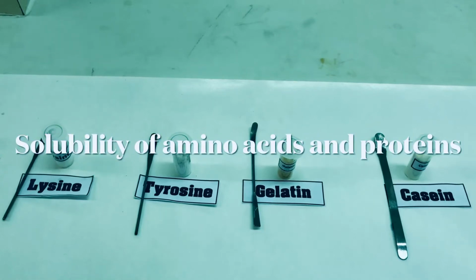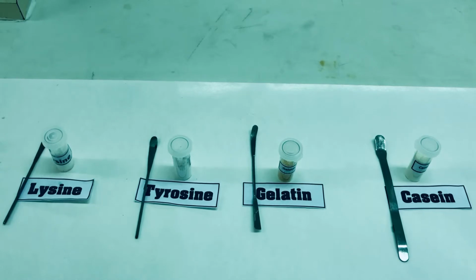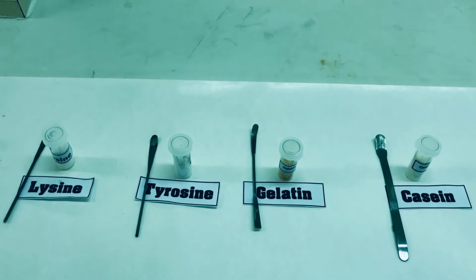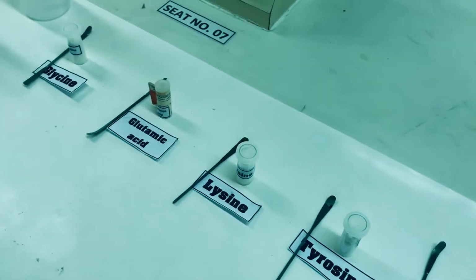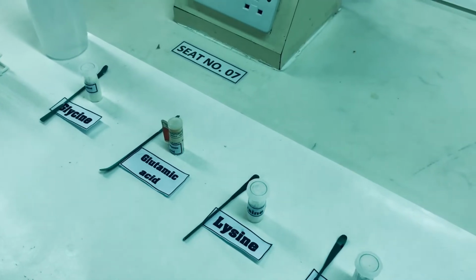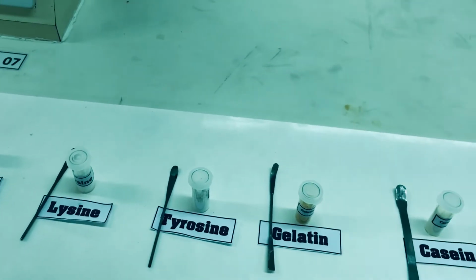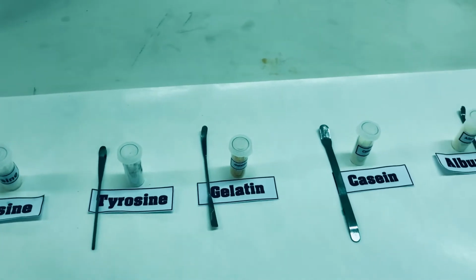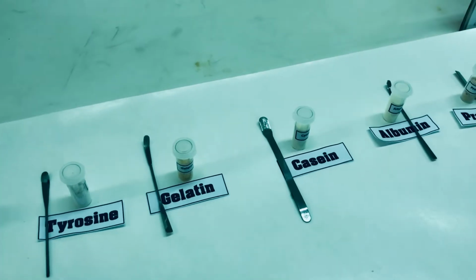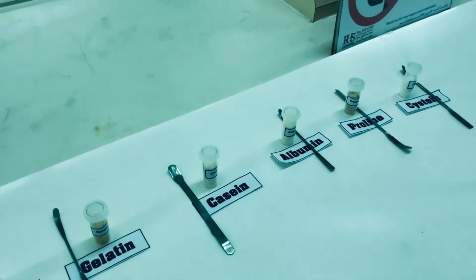The objective for today's experiment is to qualitatively test amino acids and proteins in order to describe their structure and properties. For the purpose, we have taken several amino acids like glycine, glutamic acid, lysine, tyrosine, gelatin, which is a protein, casein, which is also a protein, albumin, which is also a protein, proline and cysteine.